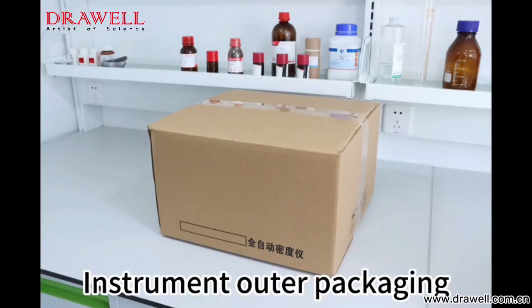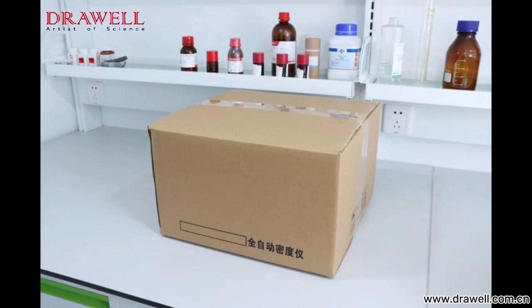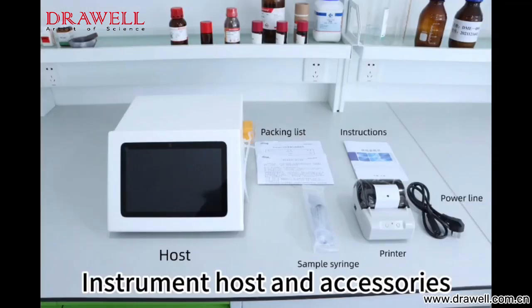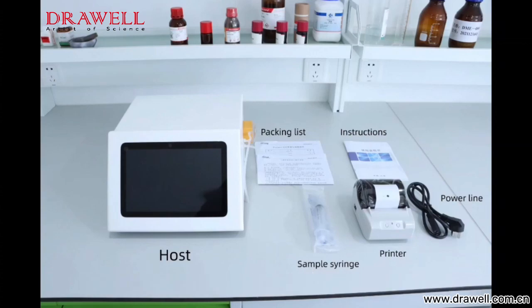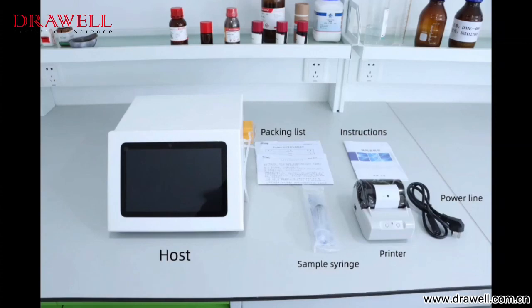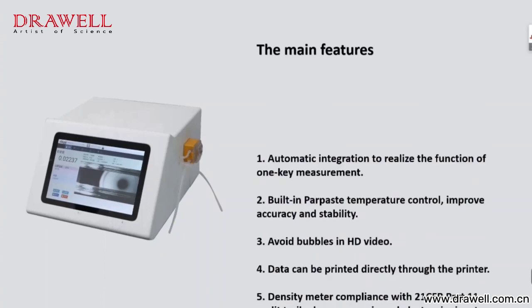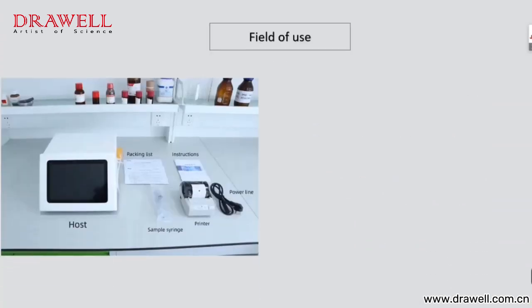Instrument outer packaging. Instrument host and accessories. The main features. Field of use.